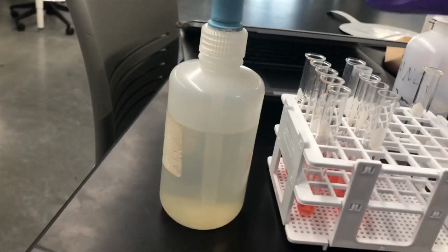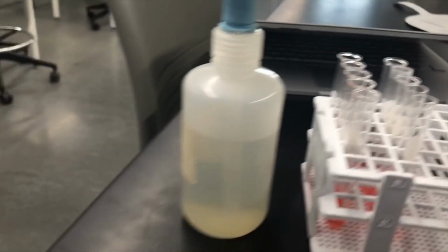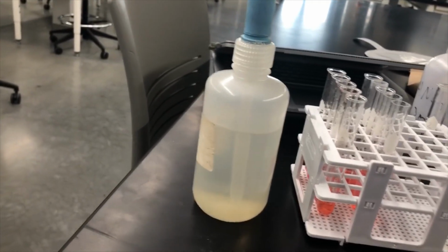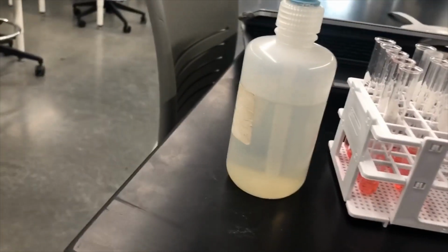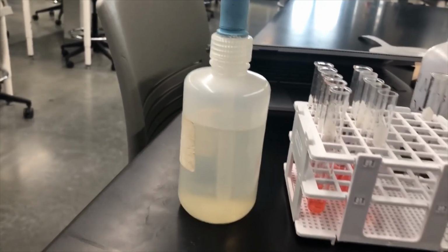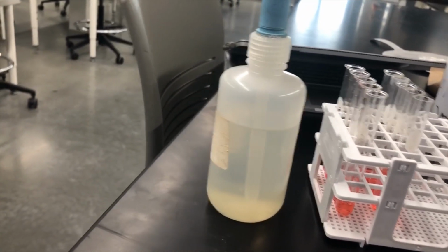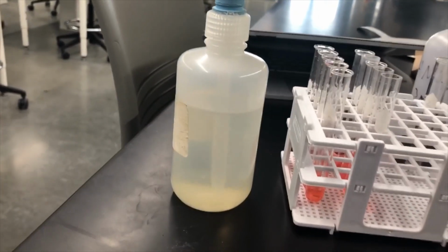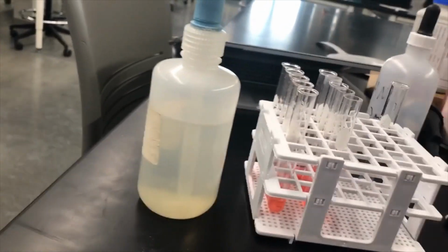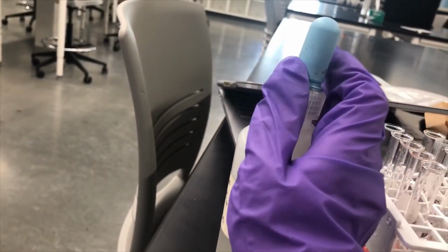So we have 3 compounds that have barium in it: barium carbonate, barium chloride, and barium sulfate. But again, this reaction will hinge on whether or not those are barium ions, or if the barium is still in a compound. If it's still in a compound, it won't react, but if there are ions present, it will, and it will form a precipitate.